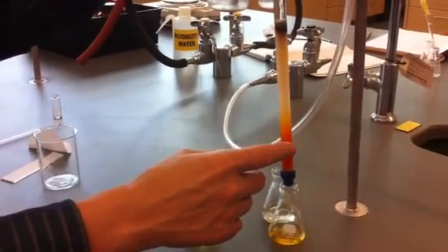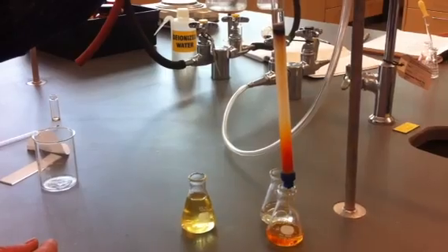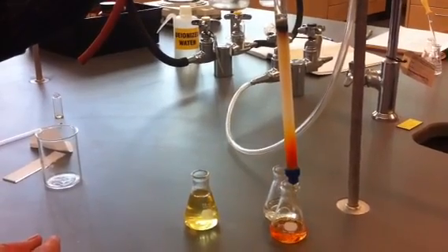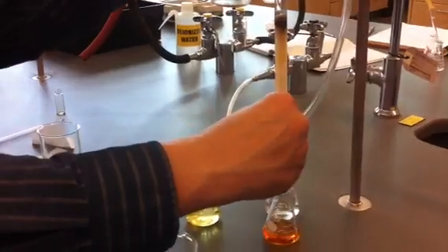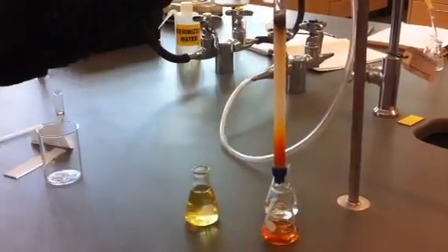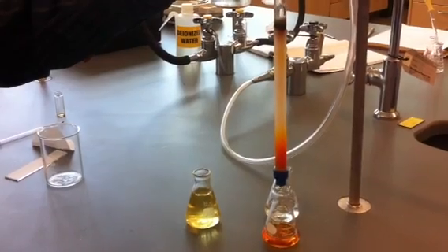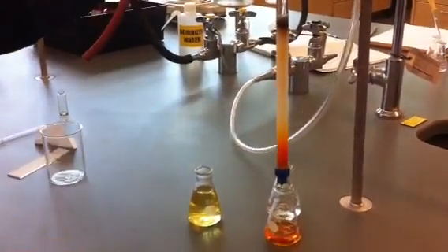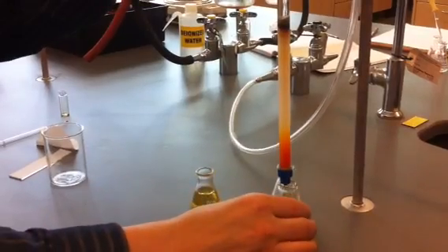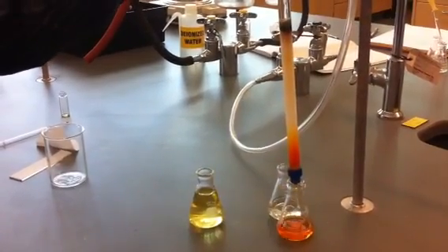One thing you have to realize is that because this is silica gel, the column is getting a little bit warm as the ethyl acetate is going in. So it has a tendency to boil. And you have to be a little bit more careful about letting the pressure off slowly, and not what I did that first time, which was just to release the pressure, because it will crack the column and kind of back up. And then it's not perfect.